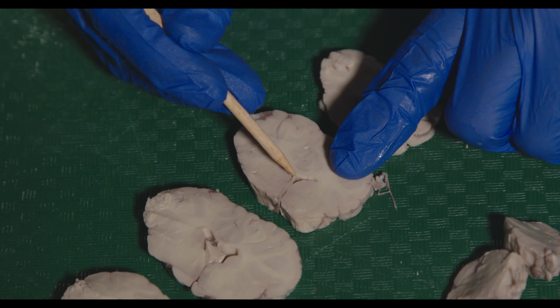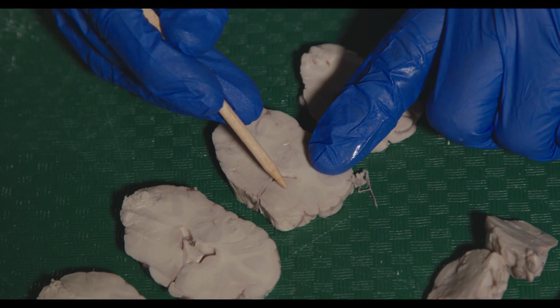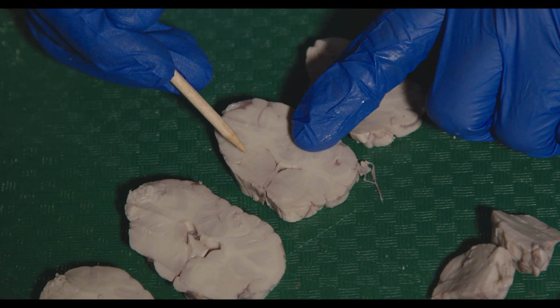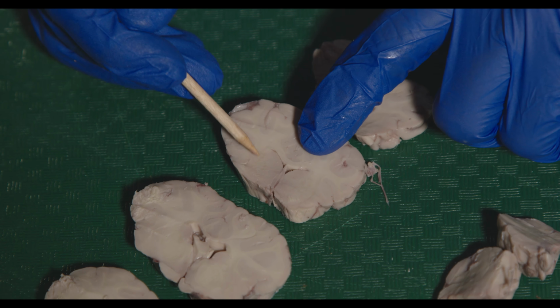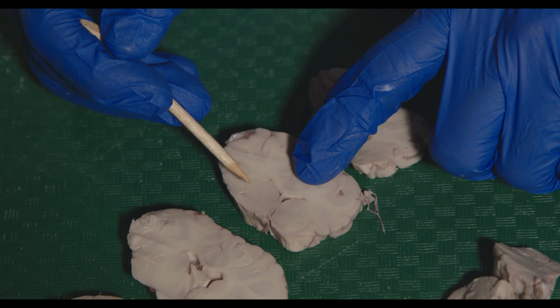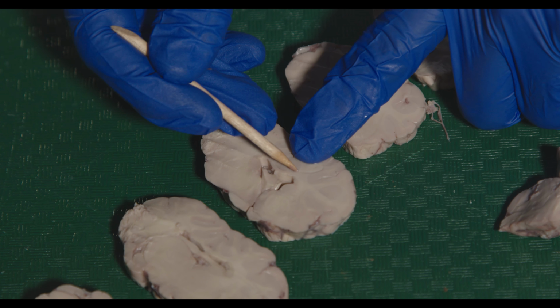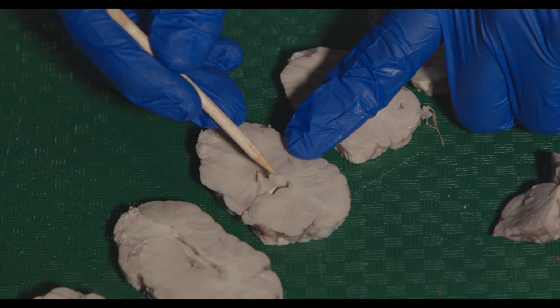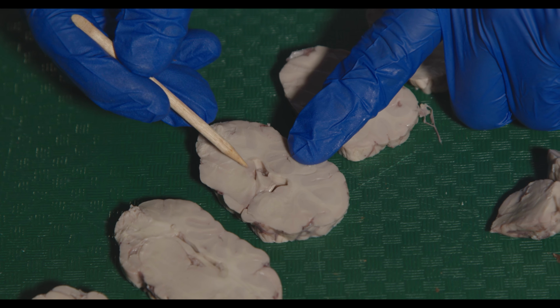What we really want to see is this guy right here. This gray matter right here, this is the caudate, one of those basal ganglia structures. And then the putamen would be on this side. We're starting to see some of the internal capsule that separates the two of them. So here we can see the corpus callosum going across again between the two hemispheres, but we can also see the lateral ventricles here. And then immediately hugging the lateral ventricle is the caudate, so we can see that on both sides.